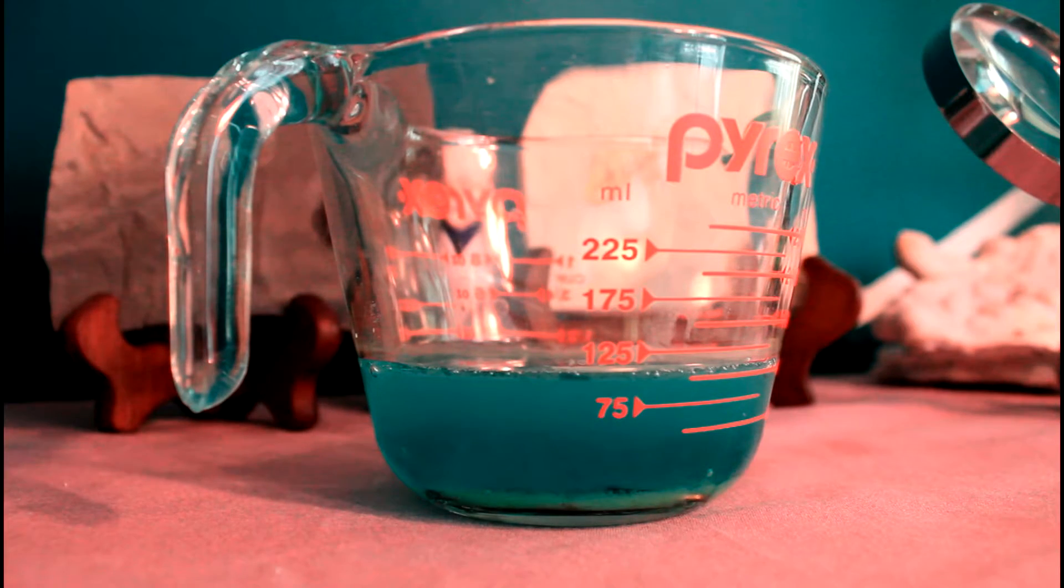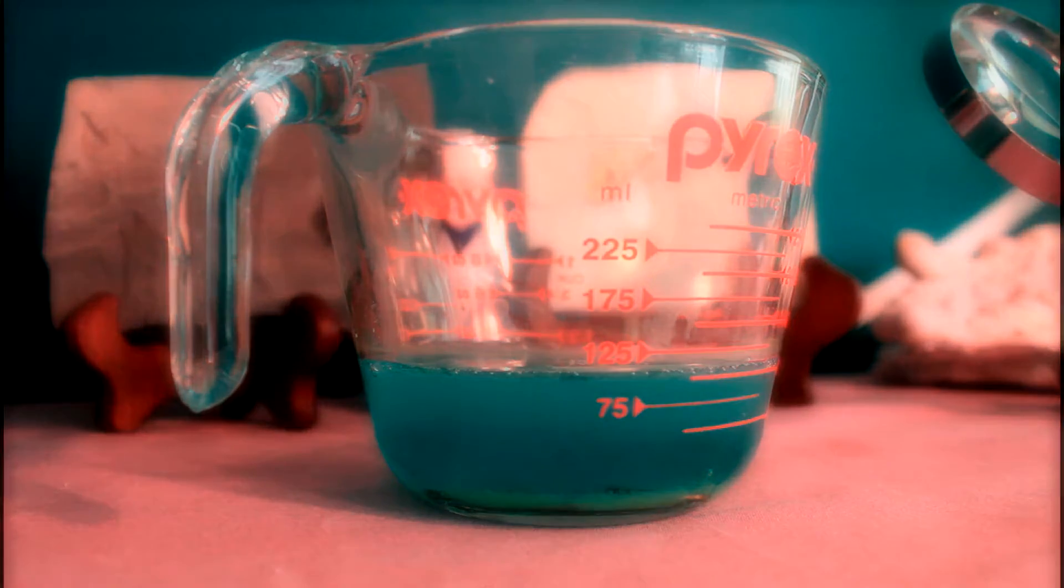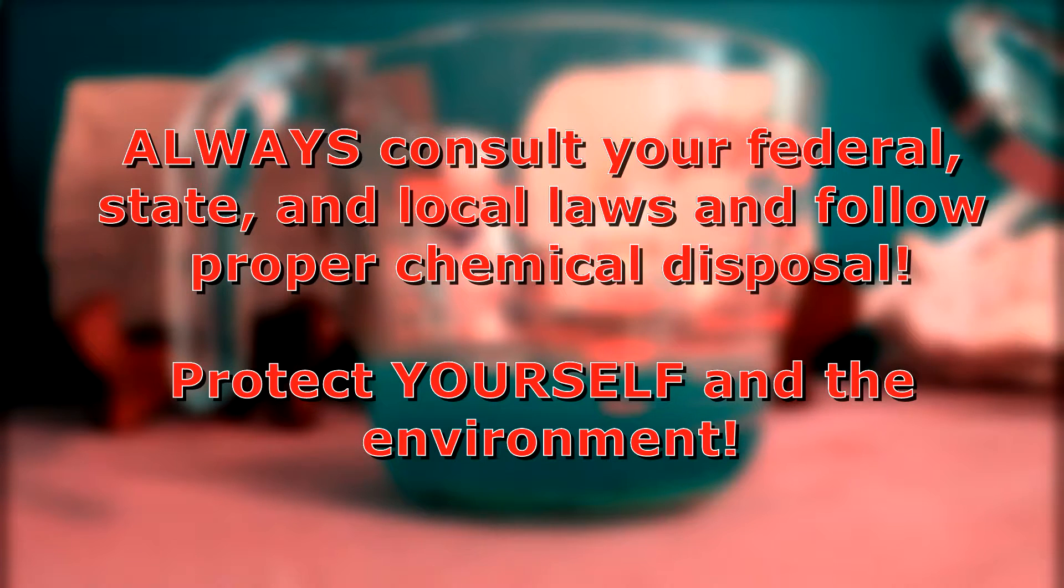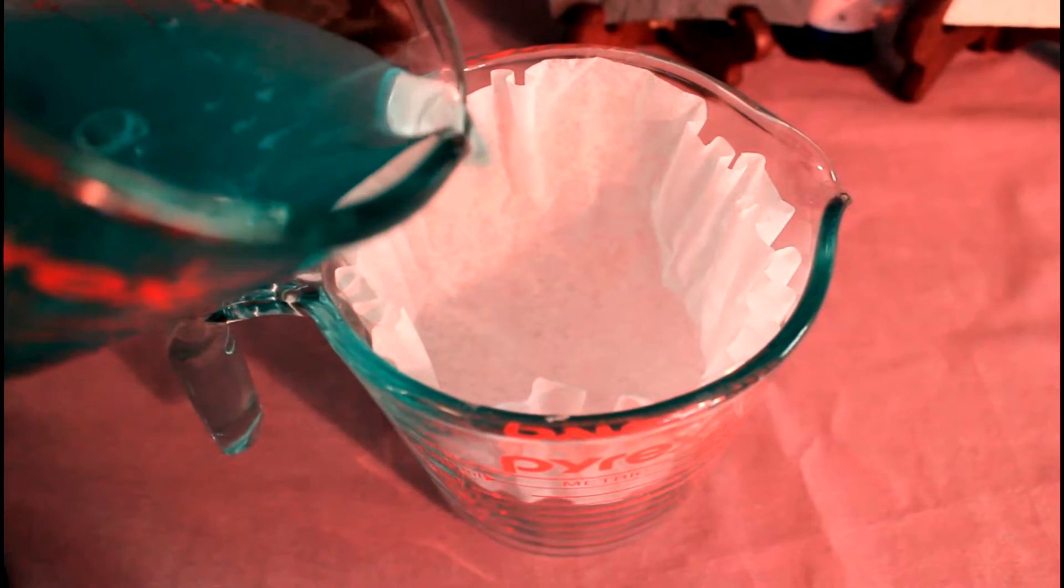So what do you do with it now? Let's be very clear here. When you dispose of any chemicals, you always need to follow your federal, state, and local laws. But that being said, why dispose of it? There are some optional things you can do here. You want to see your chemical in the solid state, don't you?